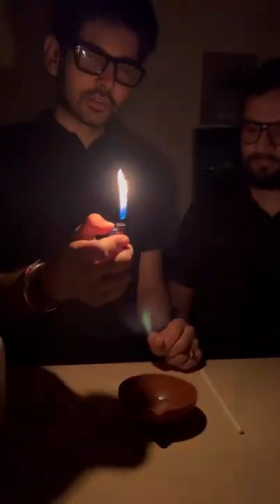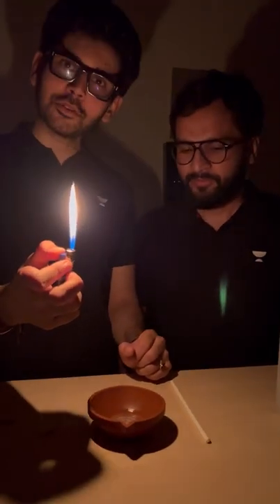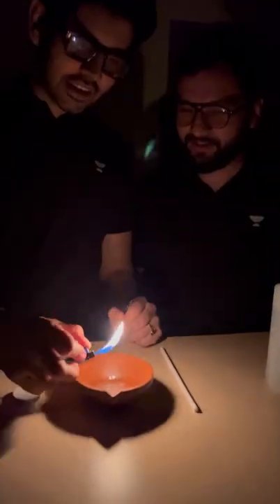Now we have the moment of truth, and we need light to stop — some darkness. Let's finally show you. And this is a green flame! How beautiful. This is an ethanol flame with boric acid.